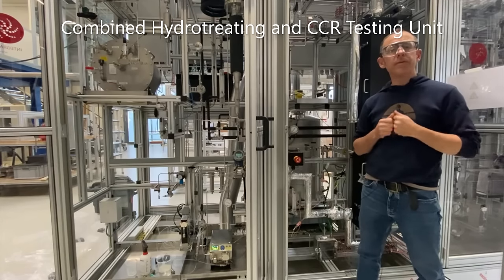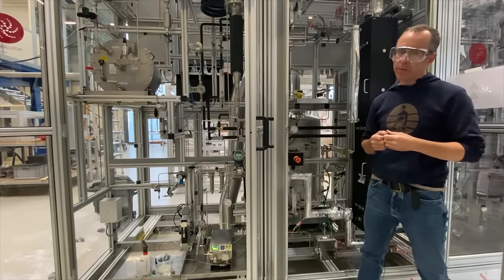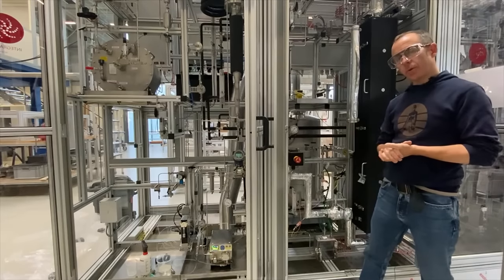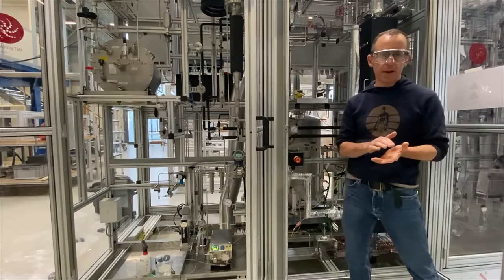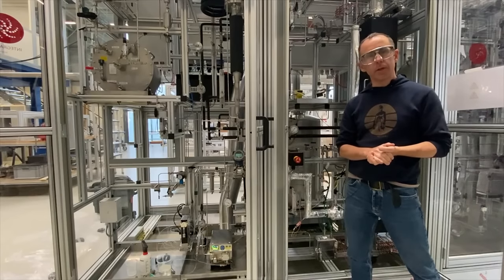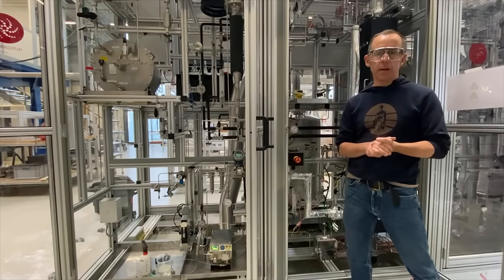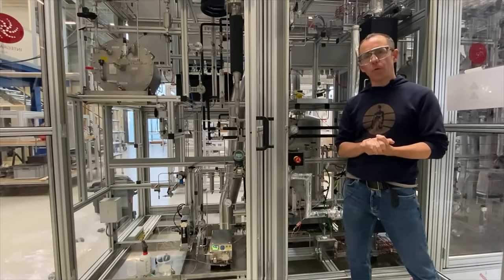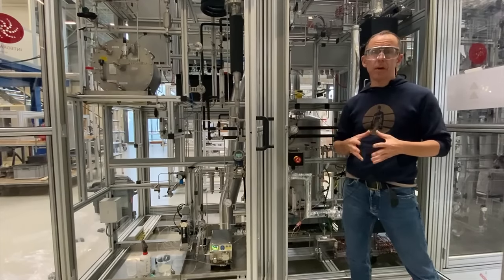In today's video I'll briefly be introducing you to our latest continuous catalytic reforming reactor, also referred to as CCR. Continuous catalytic reforming is a very well-known process used in virtually all modern refineries, where low octane feedstocks containing mostly alkanes are converted to either branched alkanes or a mixture of aromatics — ultimately BTX components — which form a high octane value blend that is then a valuable fuel.